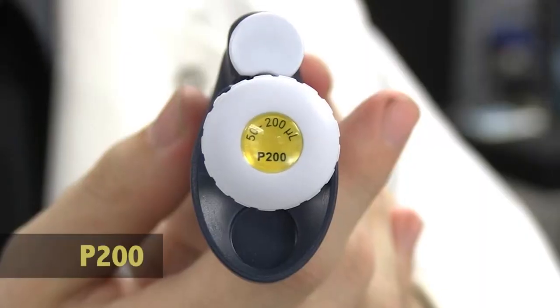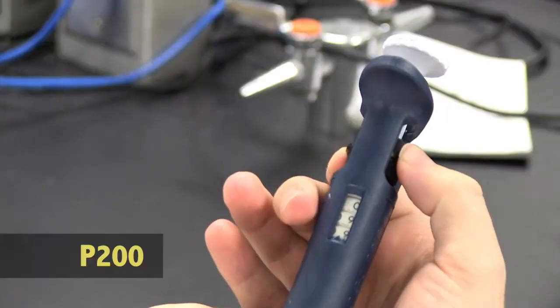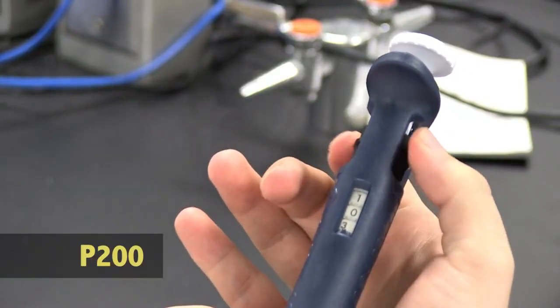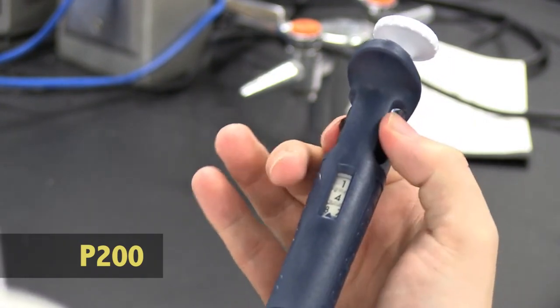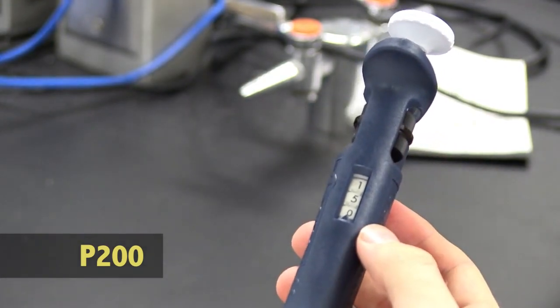For a P200, the volume that is indicated on the volume indicator is the volume the pipetter is set to. So in this case, we see that it reads 100, which means that this micropipetter is set to 100 µL. If I want to set it to 150 µL, I'll begin by turning the volume adjustment knob until it reads 150. We see that the volume indicator reads 150, which means that this micropipetter is now set to 150 µL.